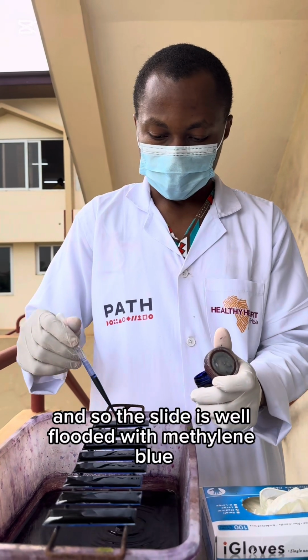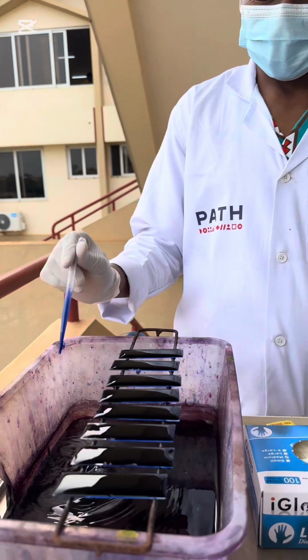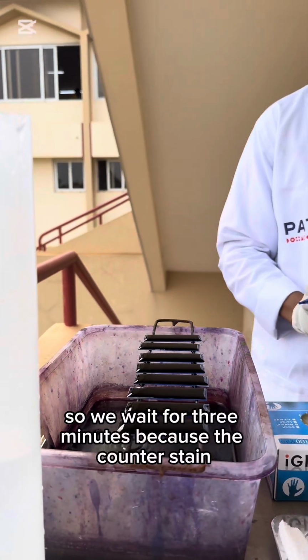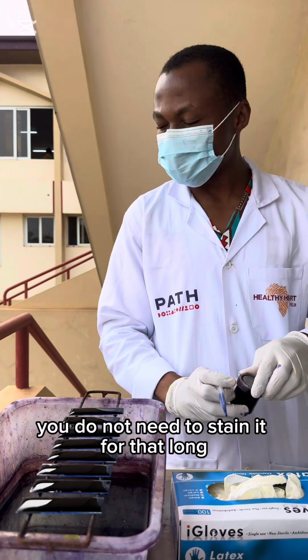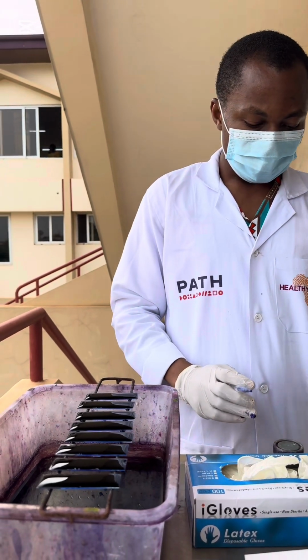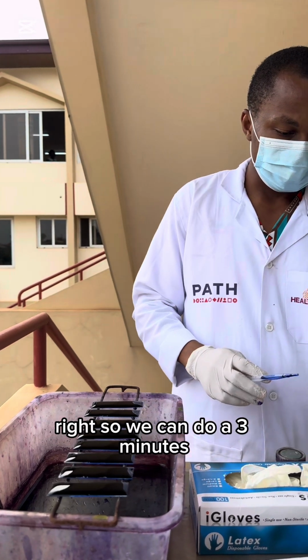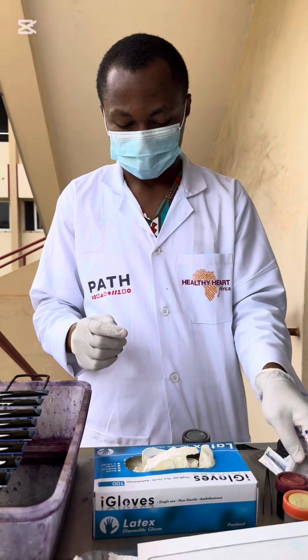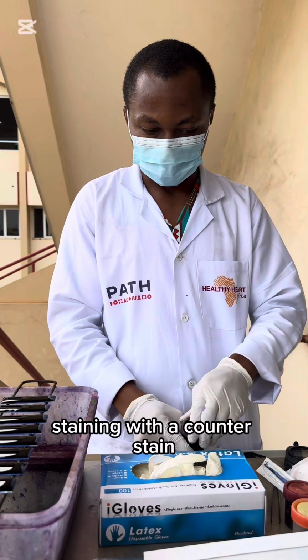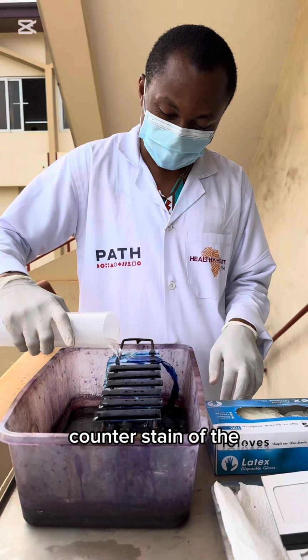So the slide is well flooded with methylene blue. So wait for 3 minutes. Because the counter stain, you do not need to stain it for that long. Some even advocate for a 2-minute or a 1-minute stain, right? So we can do 3 minutes of staining with a counter stain, the methylene blue.